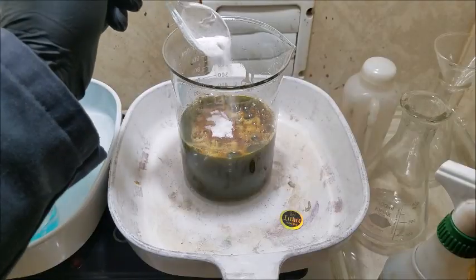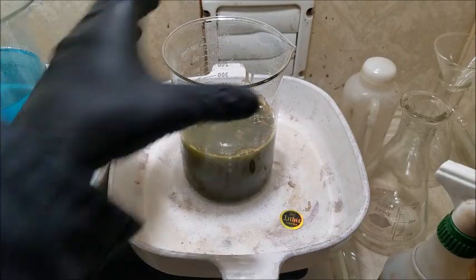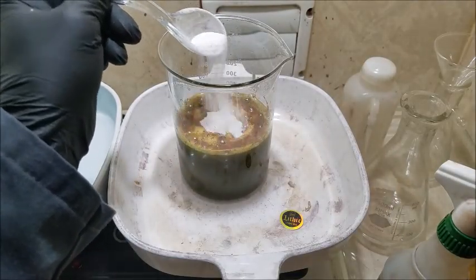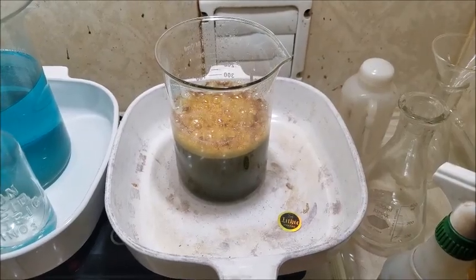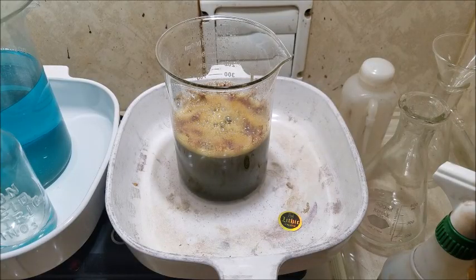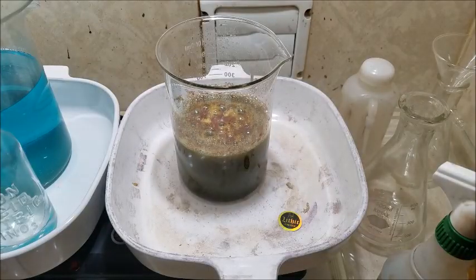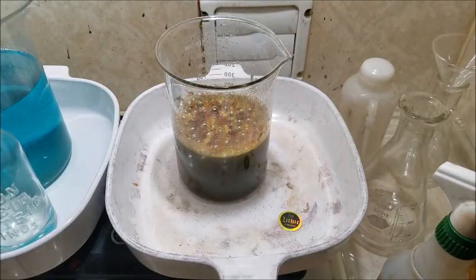Just gonna drop the iron out too now. We shall see. I might do a little research on this project after this video's done. But if any of you guys are watching, if you got some ideas of what's going on, fill them in in the comments for me. There's what I'm looking for. I'm gonna have to turn the fan up. That foam over there, that's what I was looking for. It just drops different. Still got that funky brown color though.